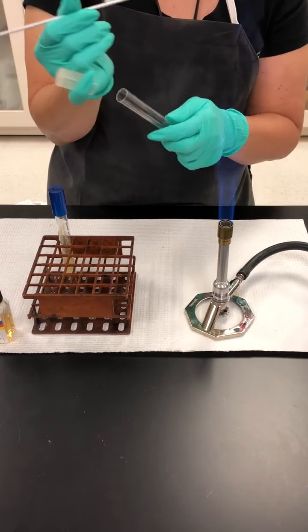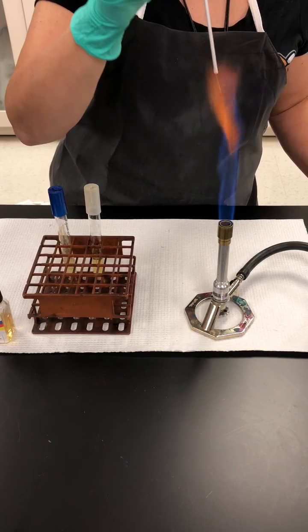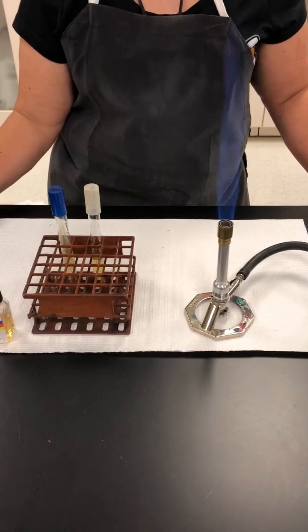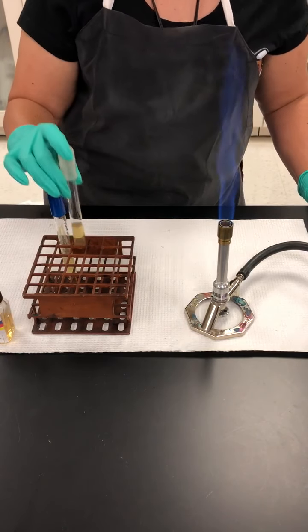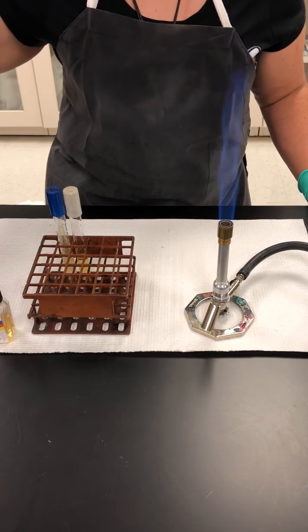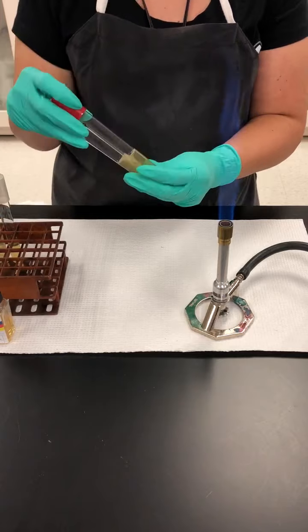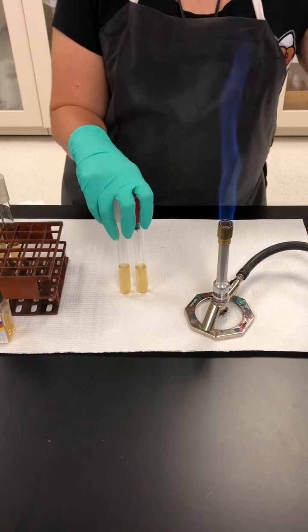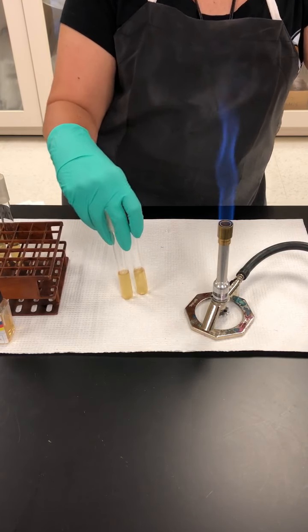You go in, out. You're going to incinerate your needle again, and this will be incubated for 48 hours at 37 degrees Celsius. Now, you're going to read first the sulfur reduction results and the motility results. You read the indole results last because you're going to have to add a reagent.